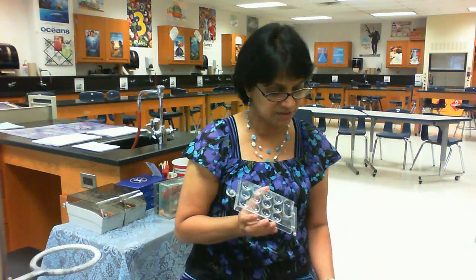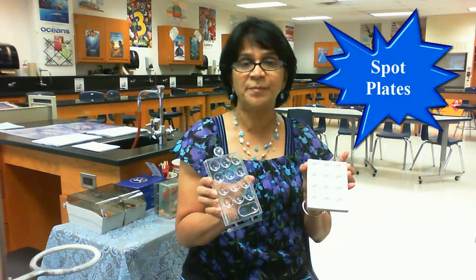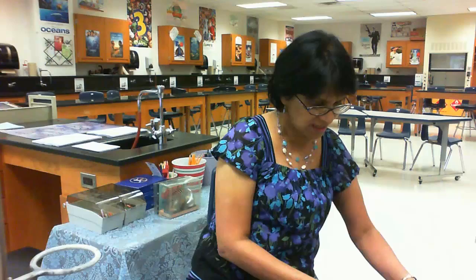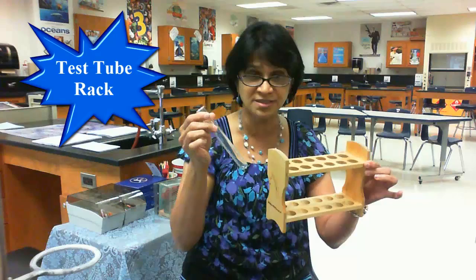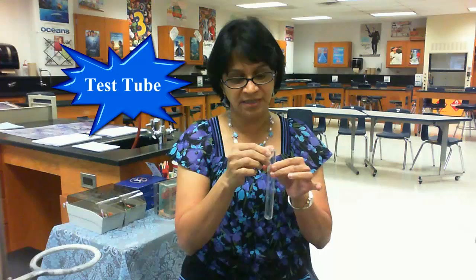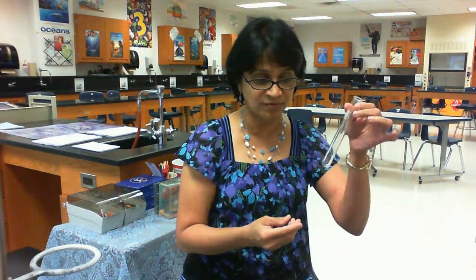We are going to talk about these two equipments. These are spot plates or well plates, and we generally use them for microscale reactions — small reactions. Then we have a test tube rack with a test tube sitting in it. The test tube rack is for keeping test tubes, and a test tube can be used for reactions. A test tube does not have any markings, so we cannot accurately measure how much liquid or solvent we have.